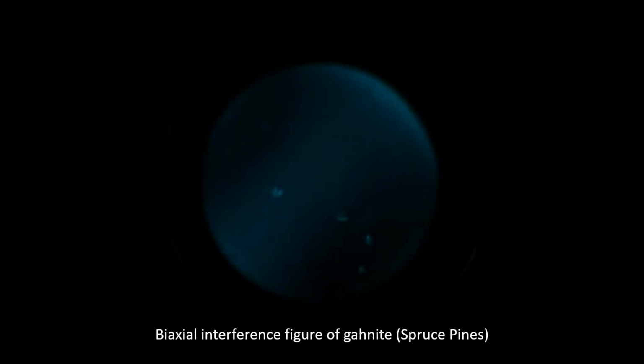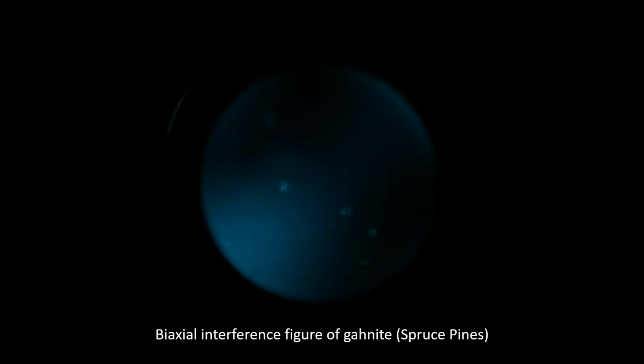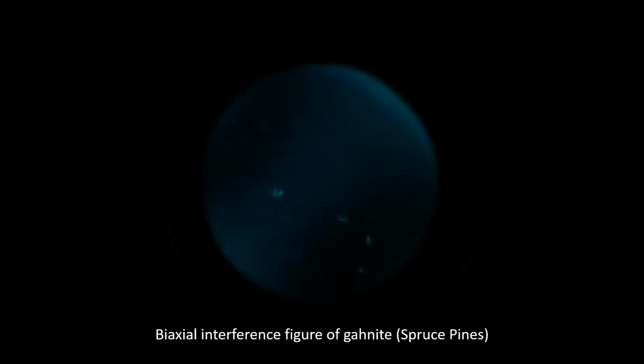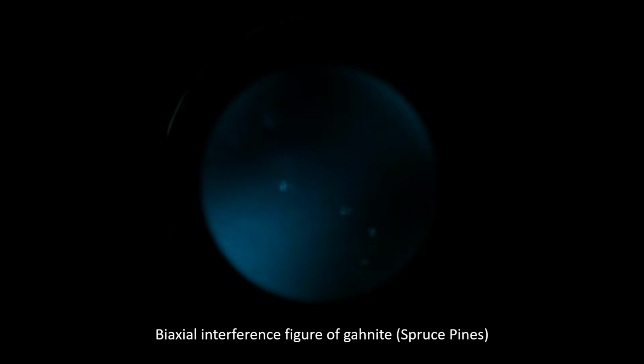However, it's important to note here that analysis with a scanning electron microscope is the only way to rule out the possibility of very small inclusions or little flecks of mica within the larger crystal as being responsible for this figure. This isn't exactly possible given the current circumstances, but after having removed all of the mica that we know of, this is the figure that we're seeing.